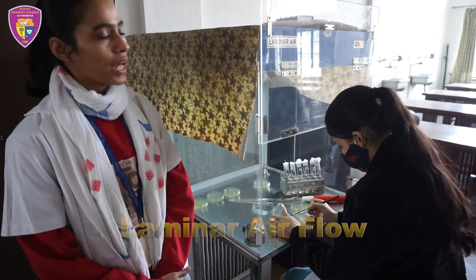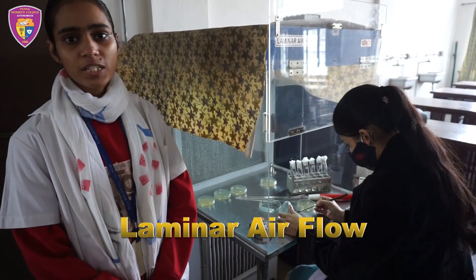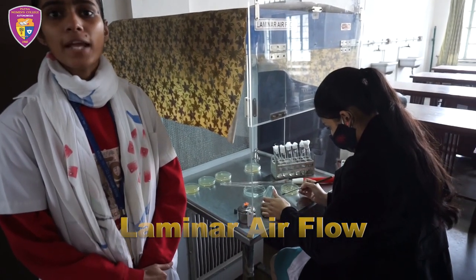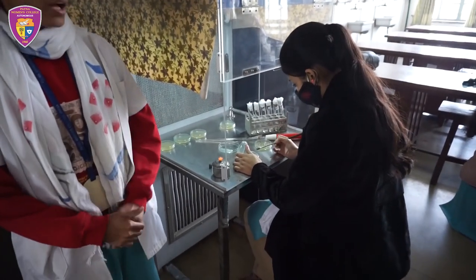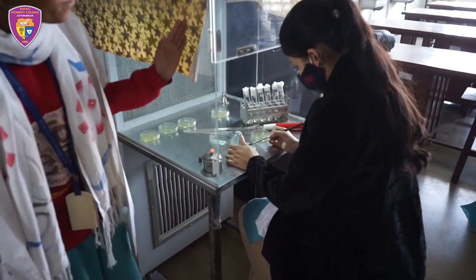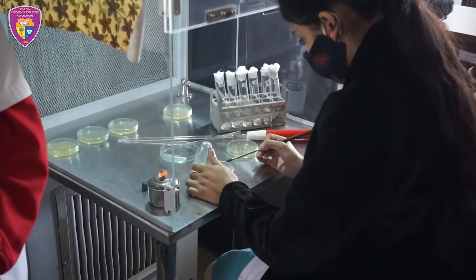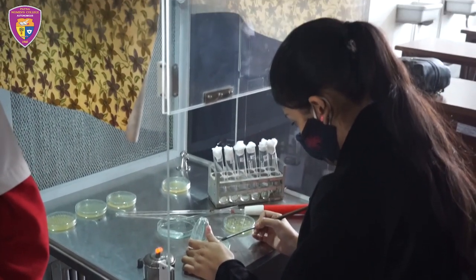This is a laminar airflow instrument and it works on the principle of HEPA filter — High Efficiency Particulate Air — and it is used to prevent contamination by microorganisms.